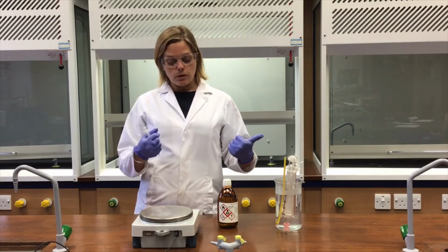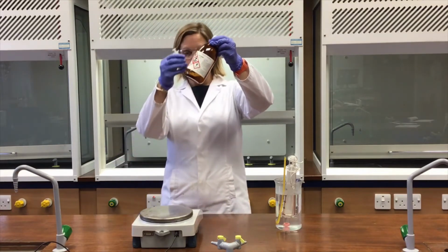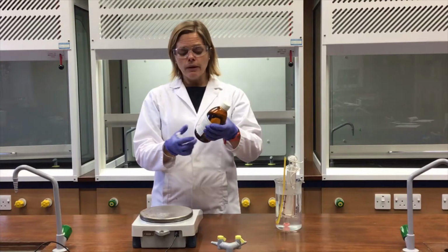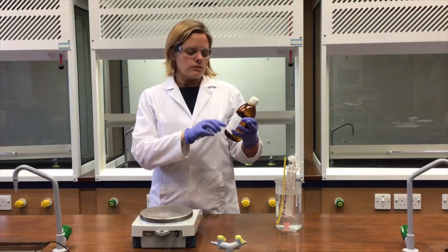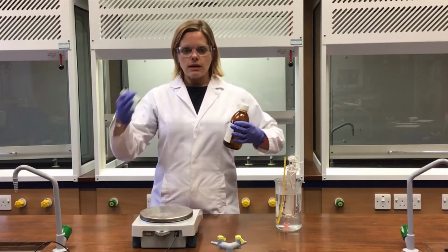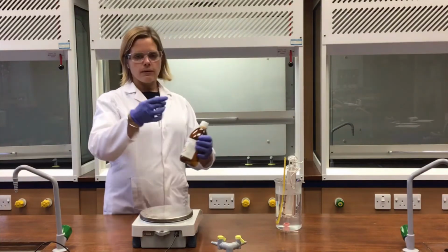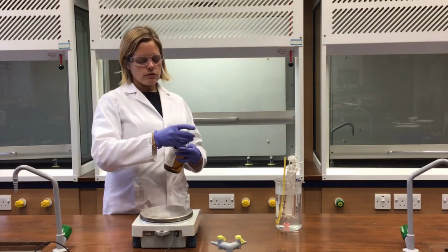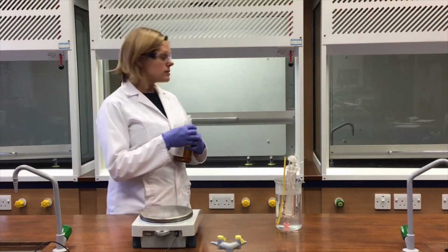I need to work in the fume cupboard for this. There's not very much in this bottle, so I need to just pour a little bit into a small beaker. Notice how there's no naked flames around. I've got the gloves on because this stuff can irritate the skin as well. So I'm going to work in the fume cupboard. It gets a bit noisy with the fan, so all I'm going to do is go into the fume cupboard, add a bit of hexane to the syringe, make sure it's all sealed and not leaking, and then I can bring that out safely onto the balance.